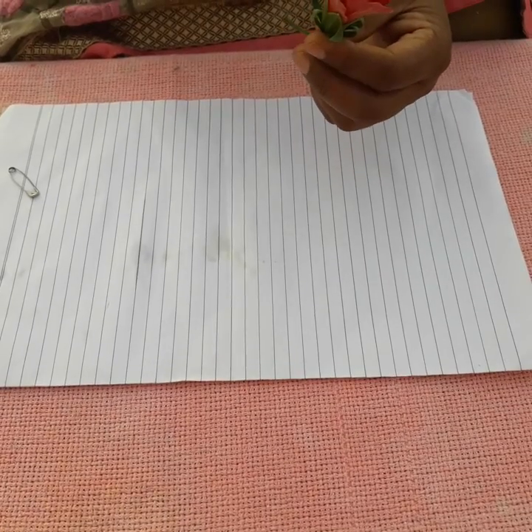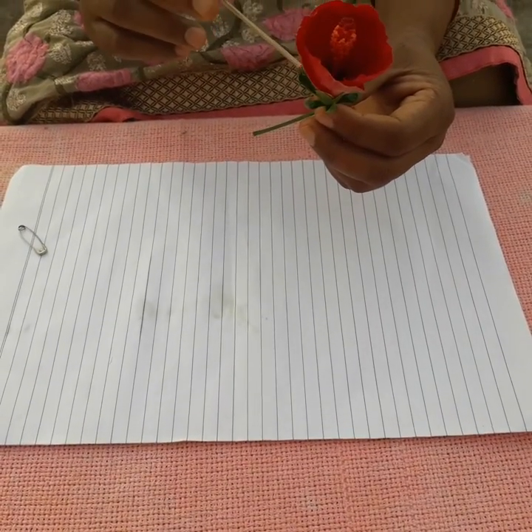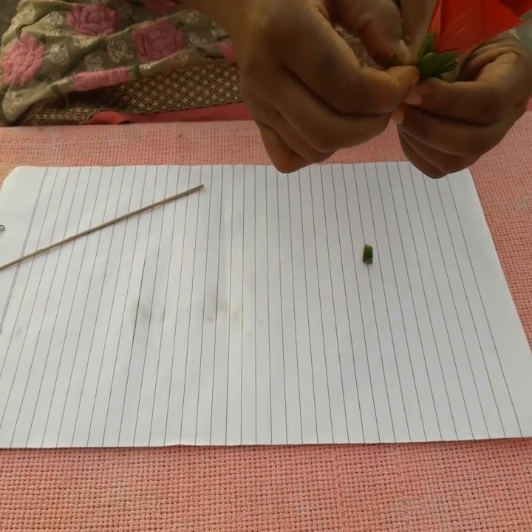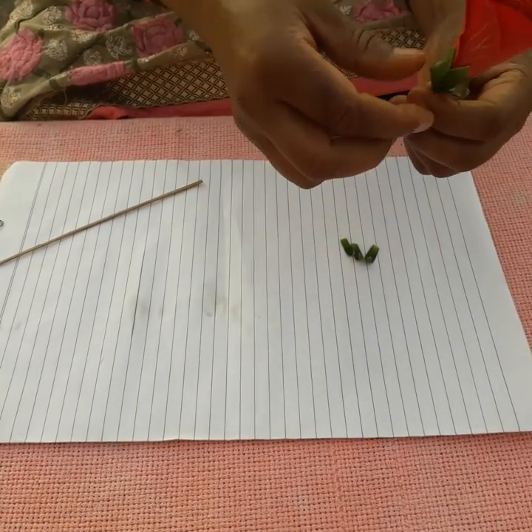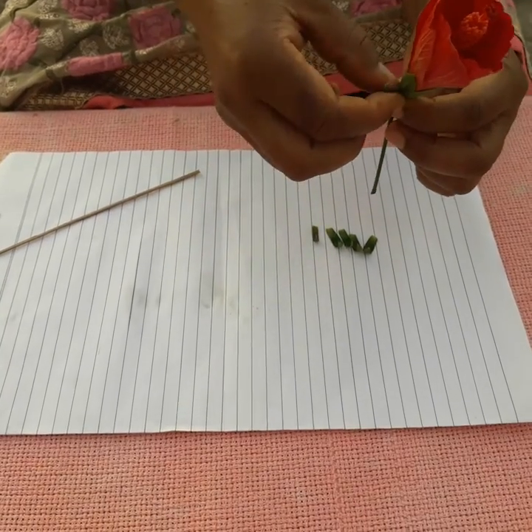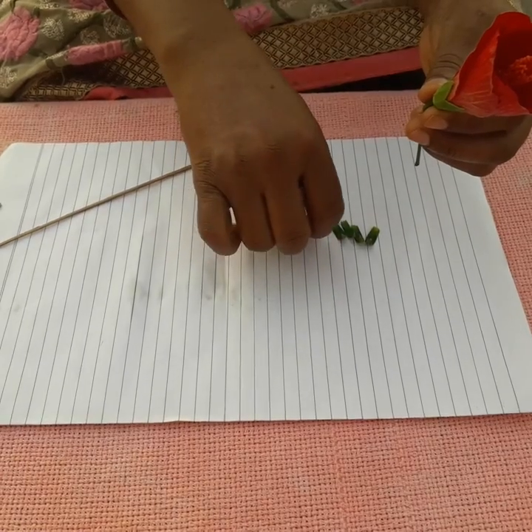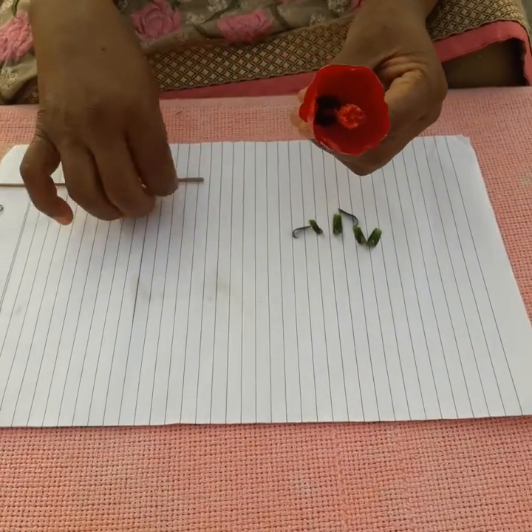There are four important whorls of this flower. Here you can see the epicalyx — I am taking out the epicalyx. This is not counted as the first whorl. The epicalyx has five members.